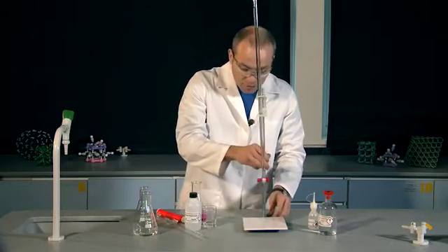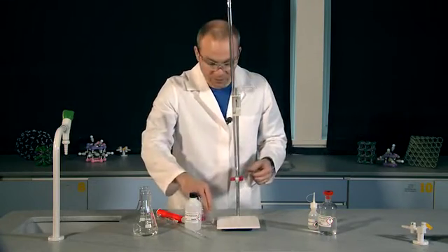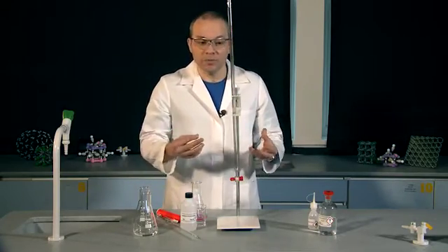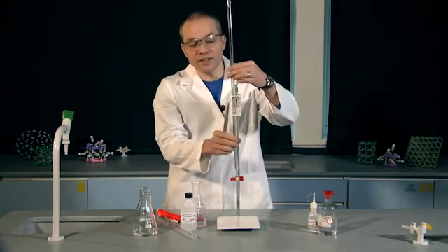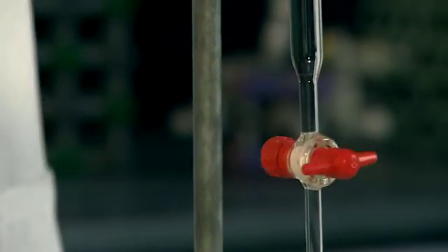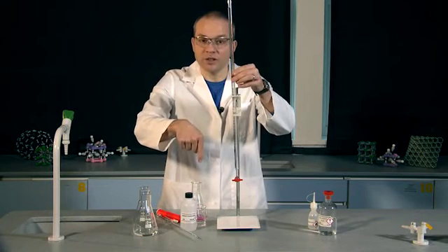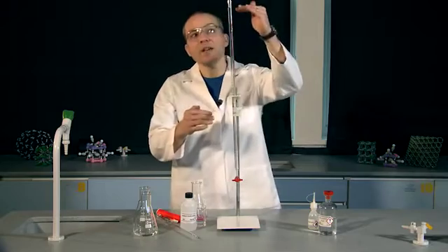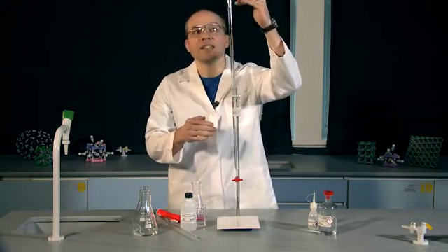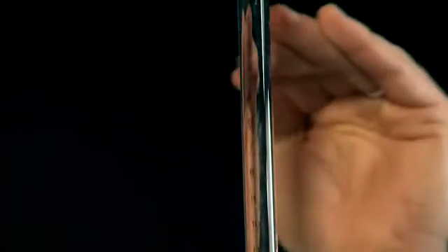I've already filled my burette with the hydrochloric acid solution. A burette is just another accurate measure of volume. It's a glass tube with a scale down one side and a tap at the bottom. The tap is closed when it's horizontal and open when it's vertical. The scale reads from zero down to 50, and I've already set it so that the base of the meniscus of my hydrochloric acid solution is sitting on the zero mark.